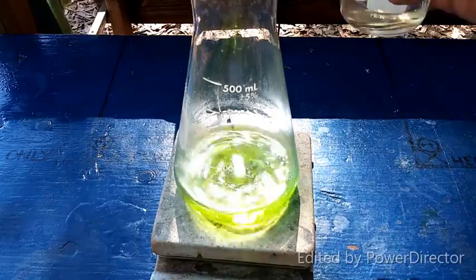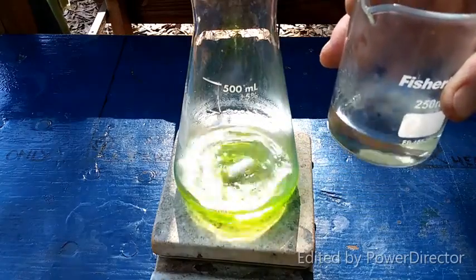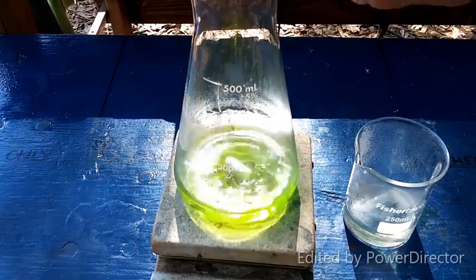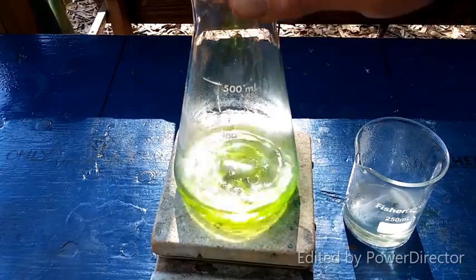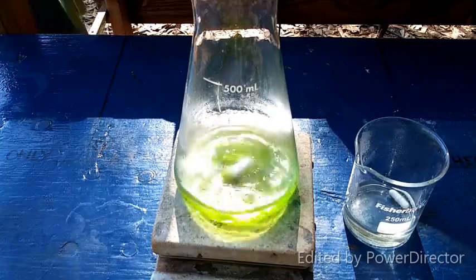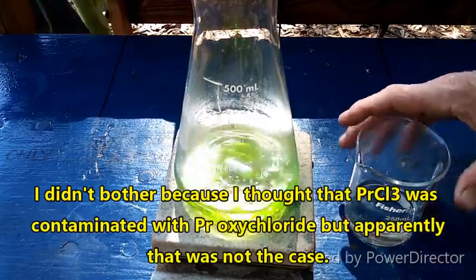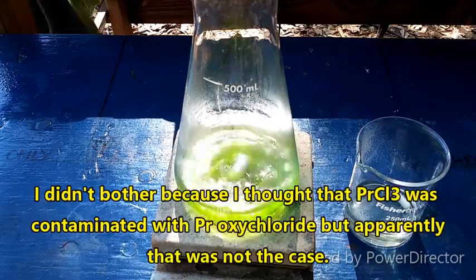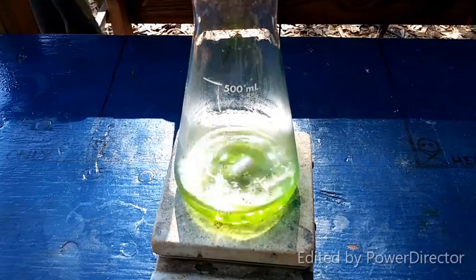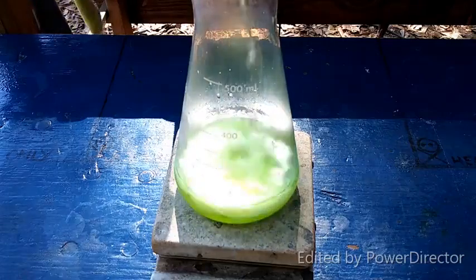This is our praseodymium-3-chloride solution in hydrochloric acid. This is 14.5 grams of oxalic acid dissolved in about 50 mL of water. Based on the stoichiometry I calculated for 10 grams of praseodymium metal — and assuming approximately 10 grams of PrCl₃ added — that's why I came up with 14.5 grams. We want an excess of oxalic acid anyway, since the lanthanide oxalates are pretty insoluble. Here we go.